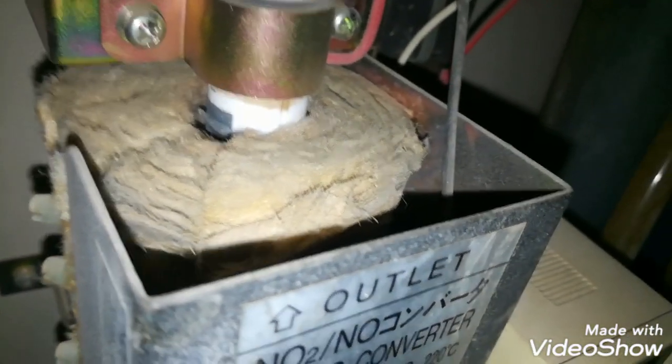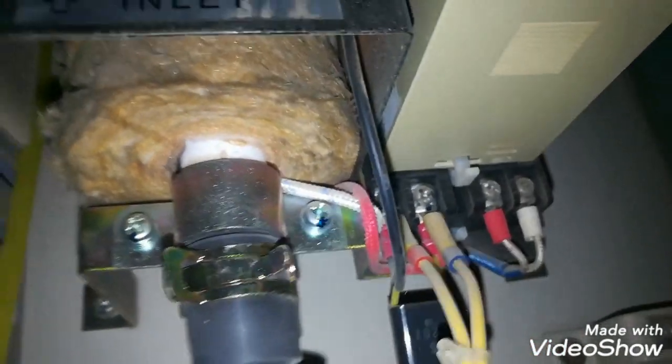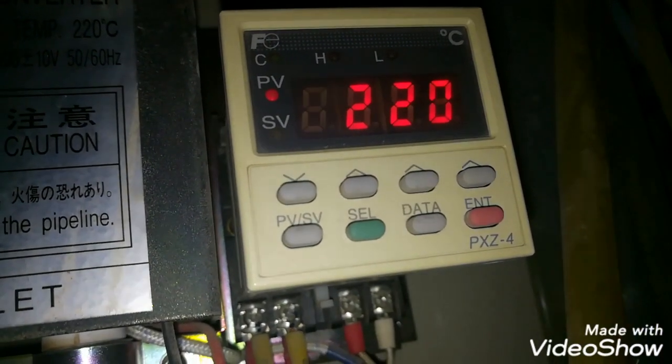This is the insulation to keep the temperature inside and keep it stable. Its working principle is that we use a carbon material as a catalyst and heat it up to 220 degrees centigrade. This catalyst converts NO2 into NO. We take the temperature using an RTD. This is the temperature controller which controls and keeps the temperature constant at 220 centigrade.